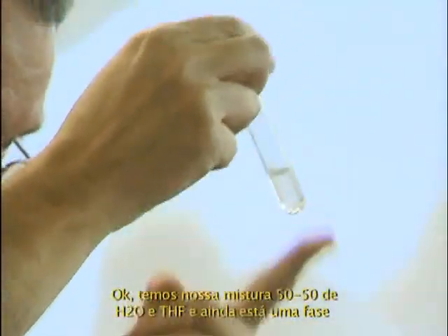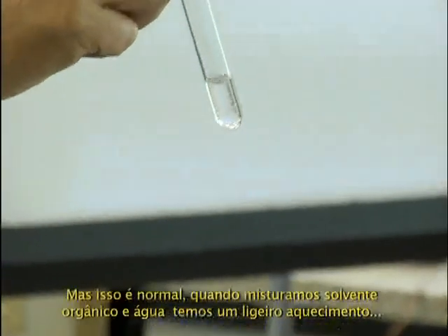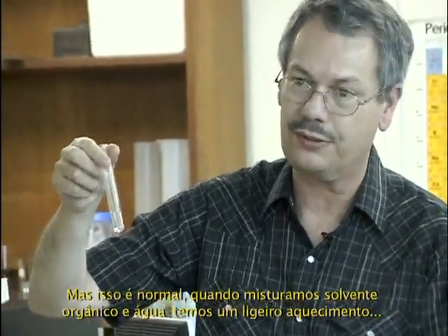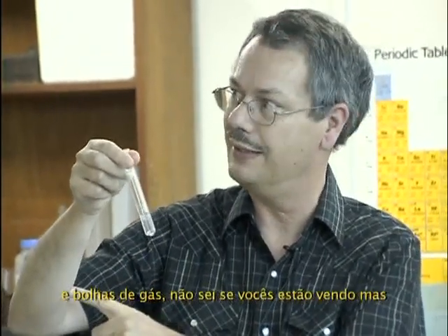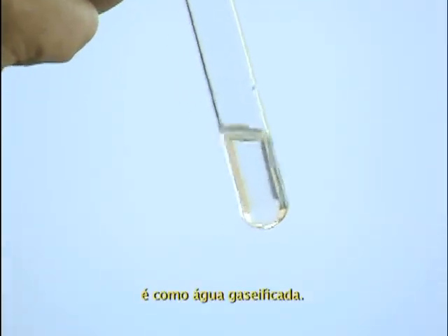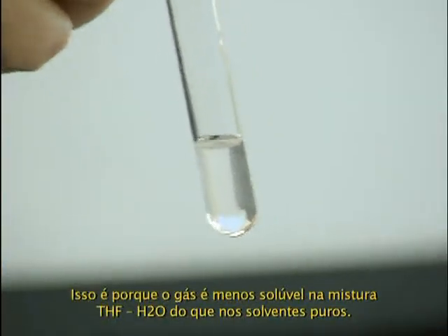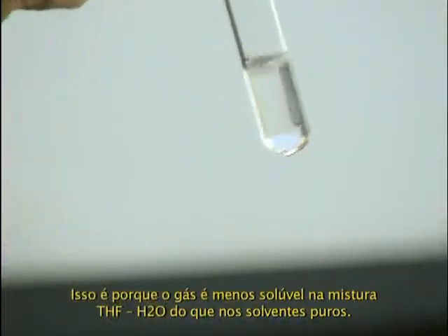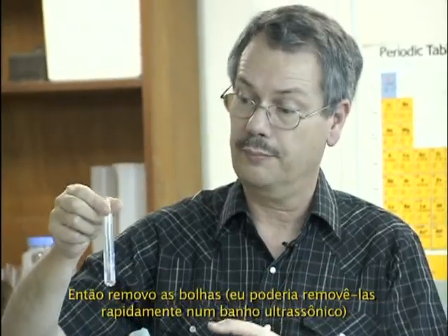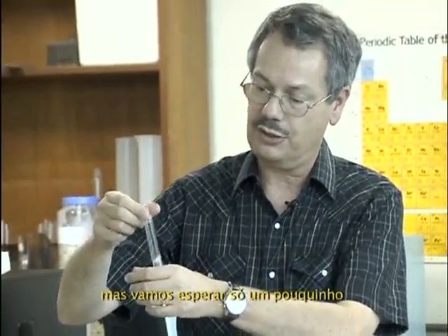I check, it's one phase. Oh my goodness, a lot of bubbles in there. That's normal. When you mix organic solvent with water, you get a small heating and gas bubbles. I don't know if you see them, but it's like carbonated water. This is due to the fact that the gases are less soluble in the THF-water mixture than in the pure solvents. So I remove those bubbles. I could remove them quickly using an ultrasonic bath, but we will just wait a little bit.